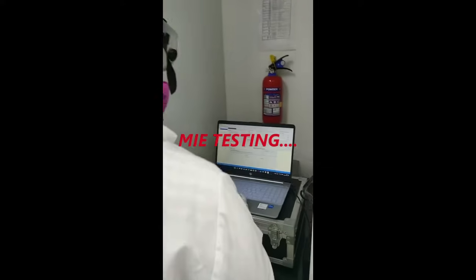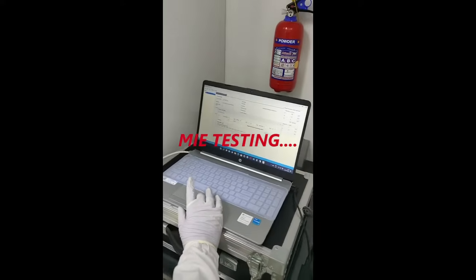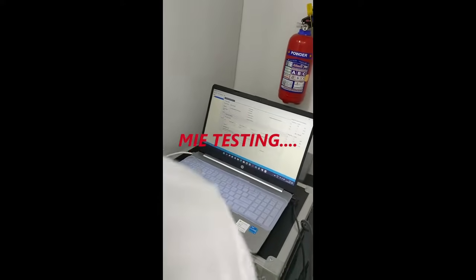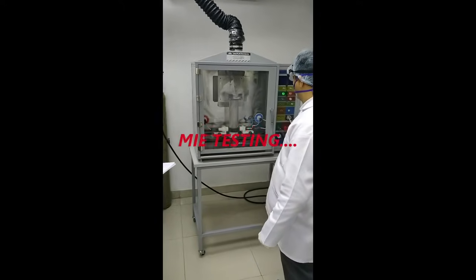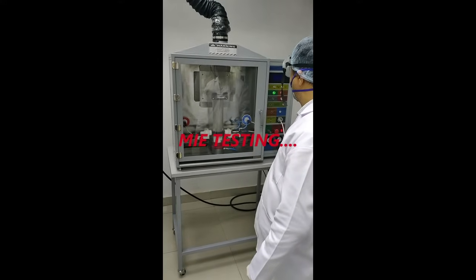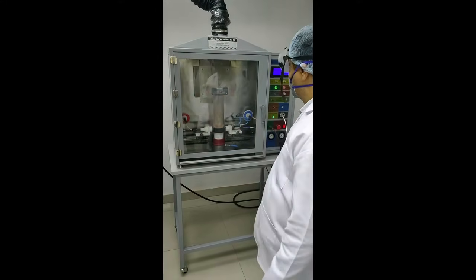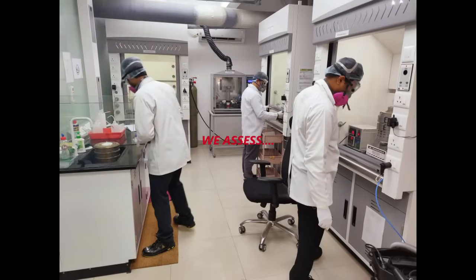Finally, the furnished report is delivered, which comprises the test methodology, the generated test data, and the recommendations pertaining to the minimum ignition energy.